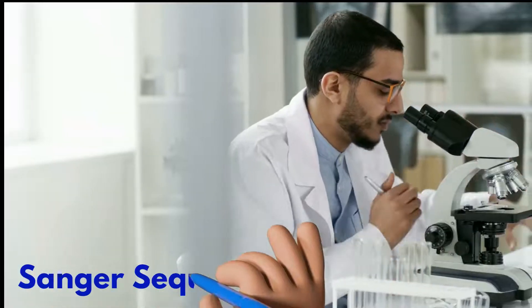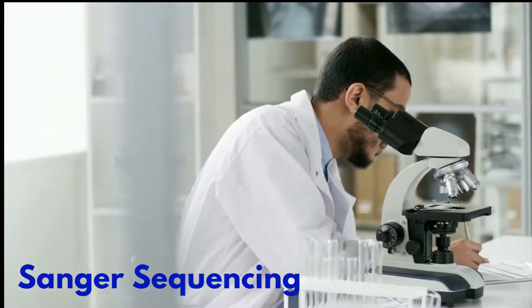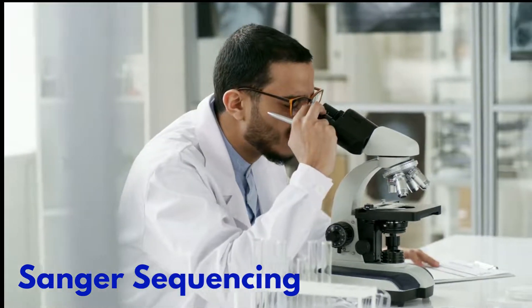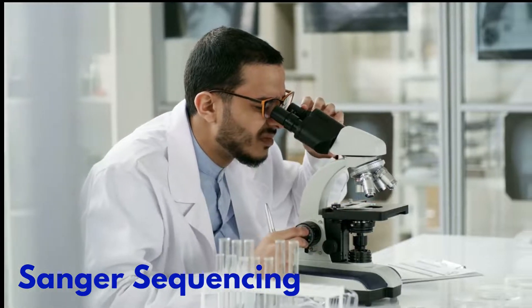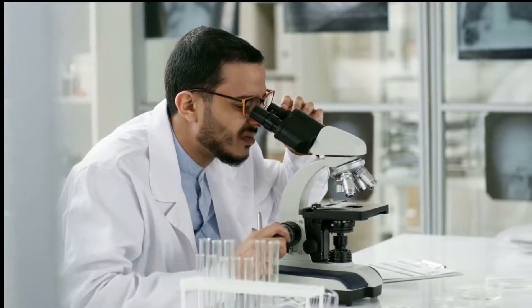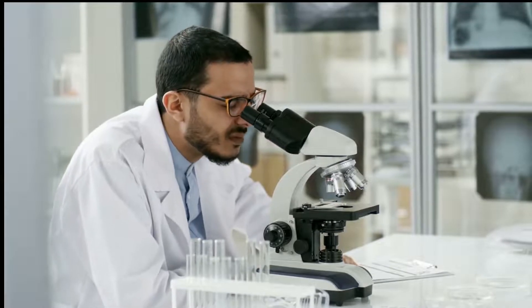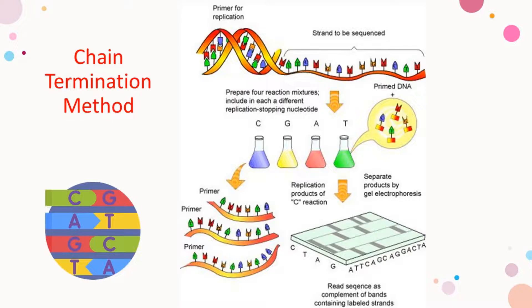Sanger sequencing, also known as the chain termination method, is a method for determining the nucleotide sequence of DNA. Sanger sequencing can be performed manually or in an automated fashion via sequencing machine. There are three main steps to Sanger sequencing.